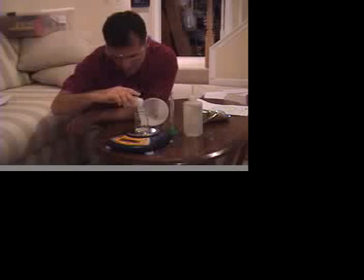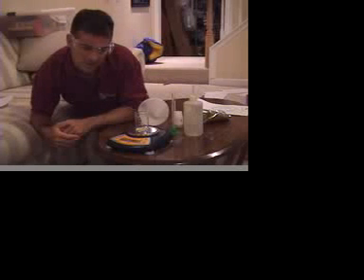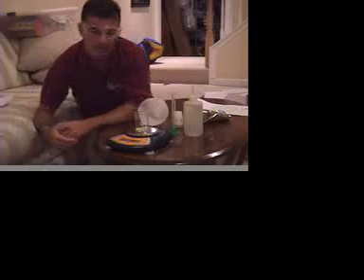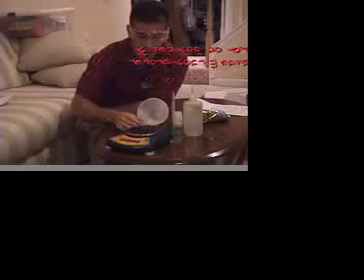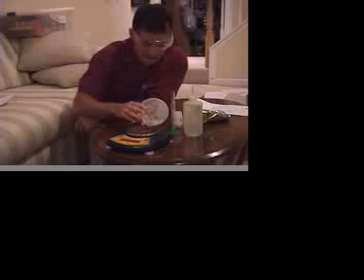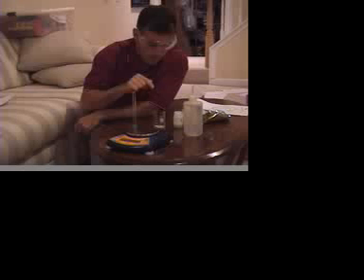Okay, there we go. This is 13.62. Okay, there we go. So the deal with that is now that I've got a good random sample, in the lab there's a place for you to record that, okay? So the next thing you actually have to do is to find the volume of that. And you're going to do that by doing a water displacement with a graduated cylinder.